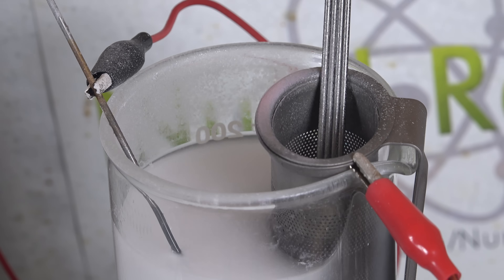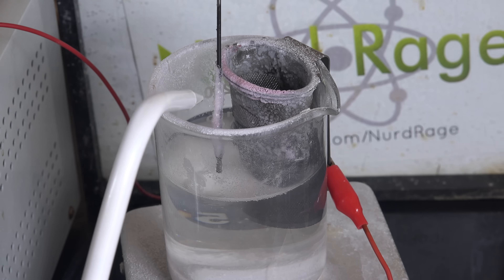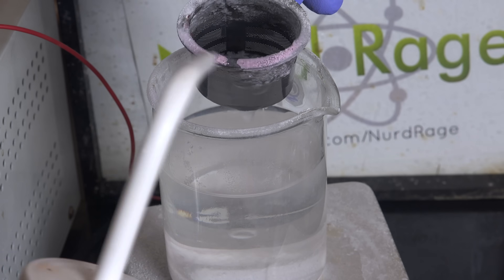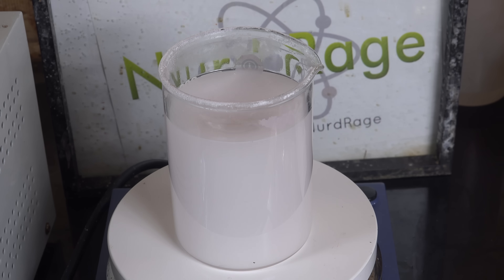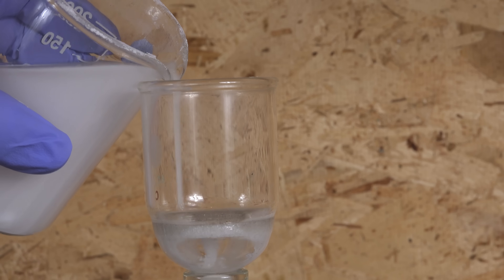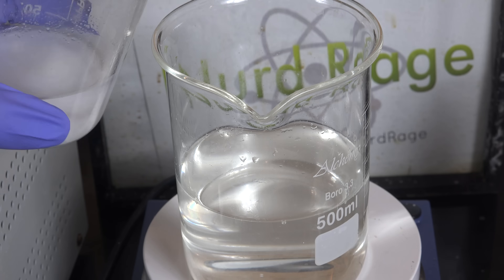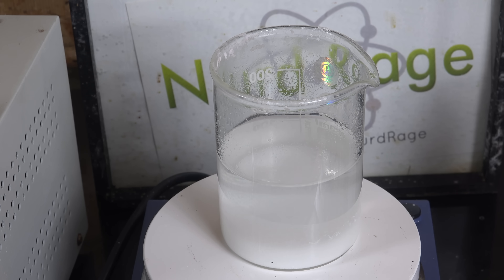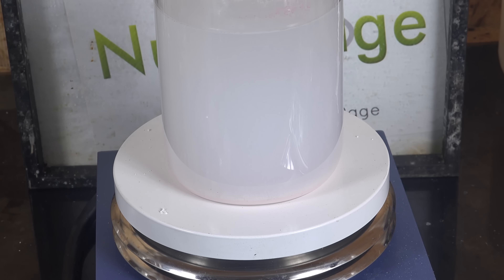So I left that going for a couple of days — it was moving around because the stir bar was strong enough to knock the beaker around, but it did work. And here we are a couple of days later. That is a solution of sodium tungstate with precipitated thorium dioxide. Boil the solution for a few minutes to dissolve and break up any sodium tungstate or carbonates. After cooling, I tried to filter the thorium dioxide but the particles are so fine they pass through. Fortunately they are pretty heavy and I could simply decant off the supernatant, then wash it with water a few times and repeat the decantation process. If you're having a lot of trouble with the particles not settling after a few hours, you can help the process a little by adding a flocculating agent. I added 100mg of aluminum sulfate dissolved in a few milliliters of water. The flocculating agent will help settle the particles but it does contaminate your thorium dioxide with aluminum oxide.